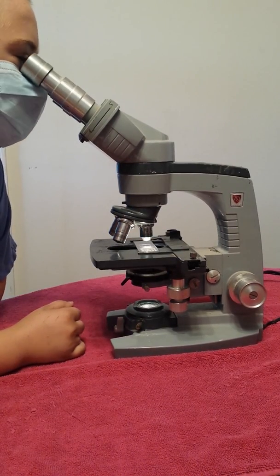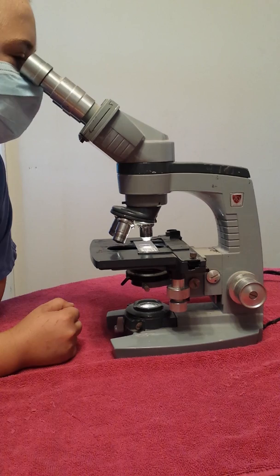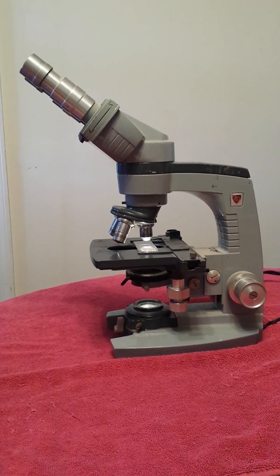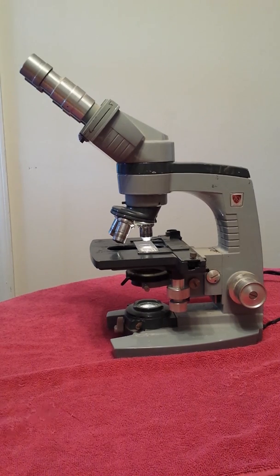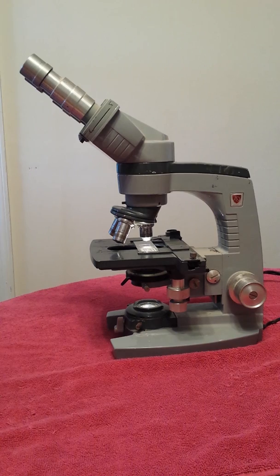Aw, man. Well, looks like my microscope is dirty and I cannot see through it. Well, I guess it's time to call another microscope company. Hey, I know. I can call Valley Microscope Company. They can do microscope service on site. Oh, that's cool. It sounds like a very interesting company. Can you give them a call? Sure, why not? Okay.